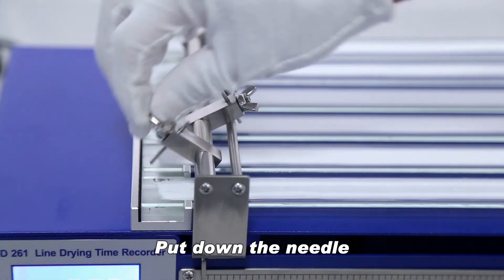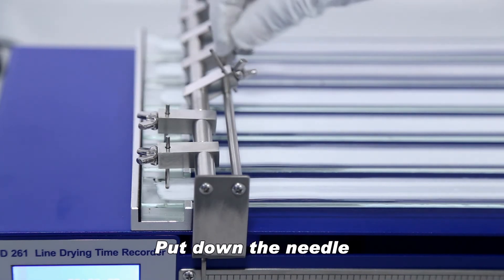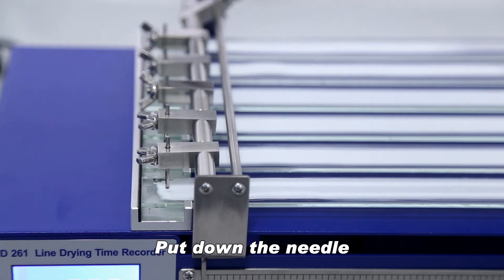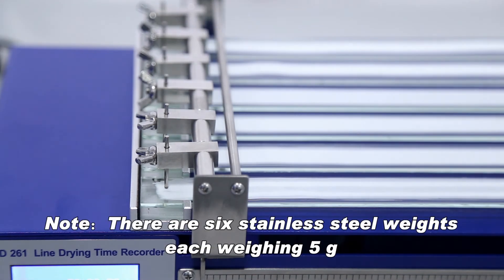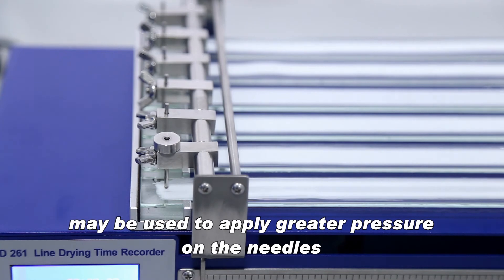Put down the needle. Note: there are 6 stainless steel weights, each weighing 5 grams, that may be used to apply greater pressure on the needles.